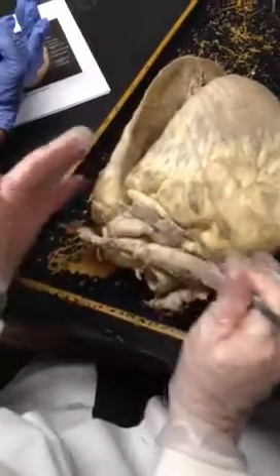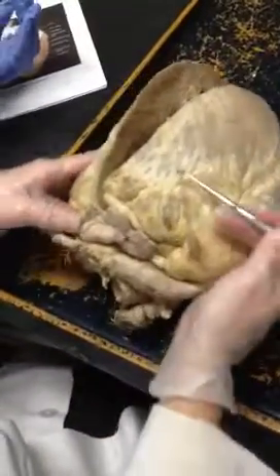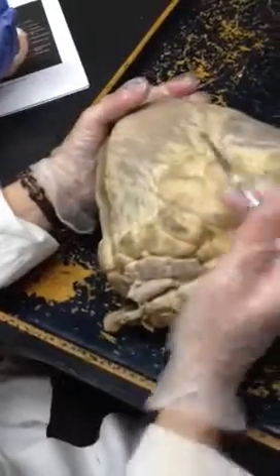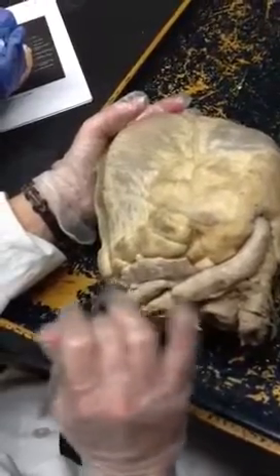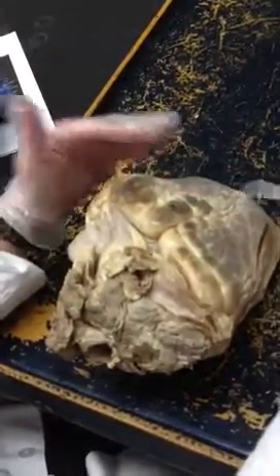It would be the one that goes around this way rather than down. If there's a groove, it goes all the way around — it goes between the atrium and the ventricle. So think of it as between the atrium and the ventricle section is the coronary sulcus, which is the groove. The ventricular sulcus definitely goes down the ventricles — it's just easier to see here.